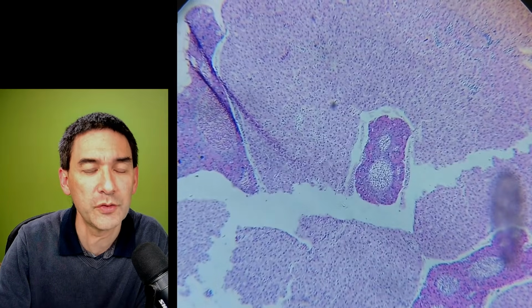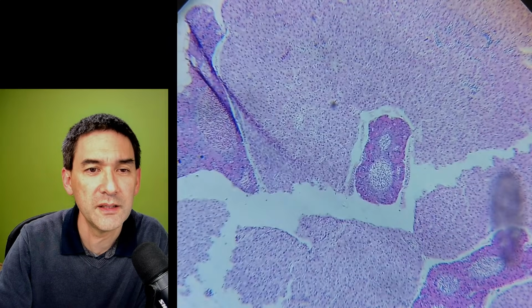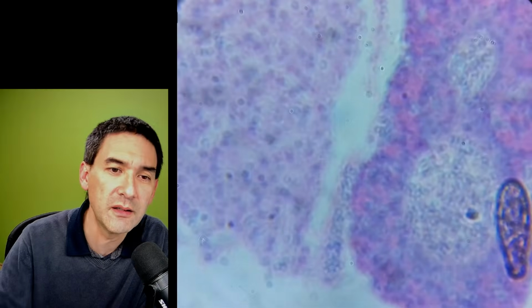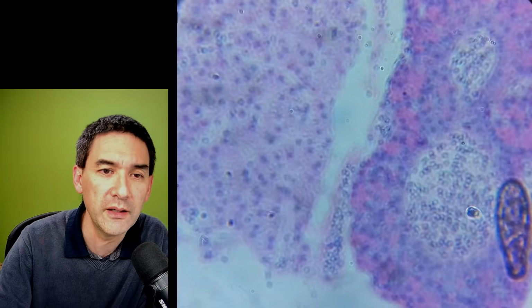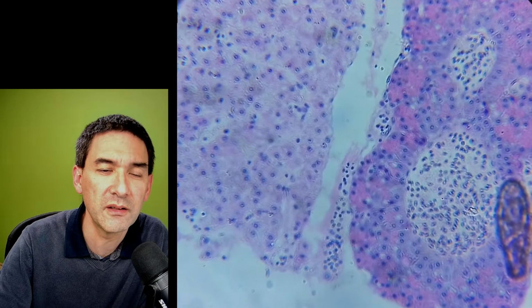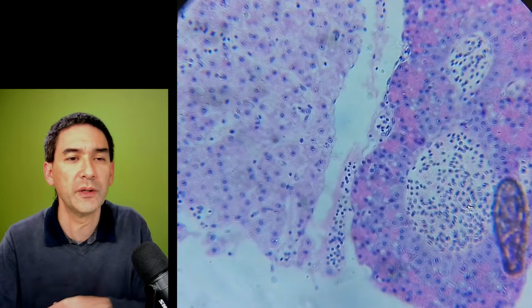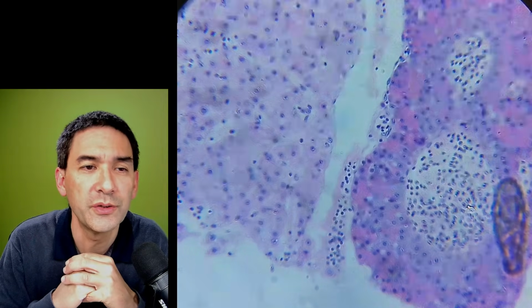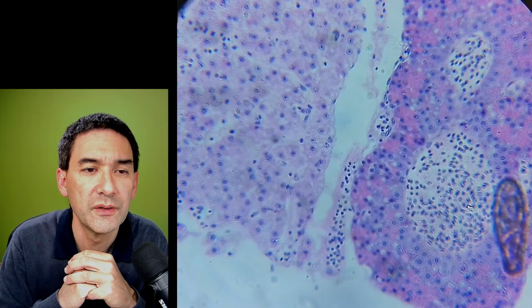See, it always refocuses. Those tiny dots that you see, there seems to be some kind of stain. They've stained the nuclei of the cells. So that's a histological specimen. It is very annoying that it always refocuses, but if I don't focus, it also does not adjust the focus.